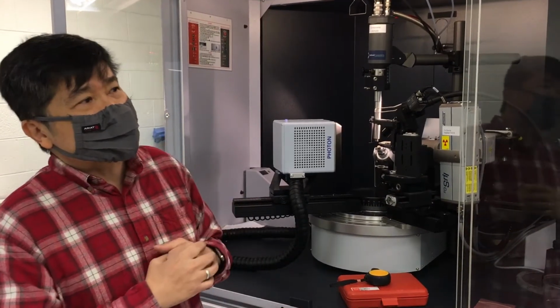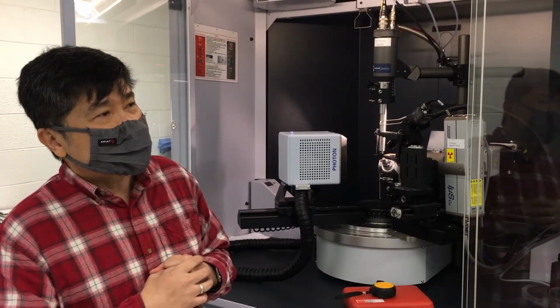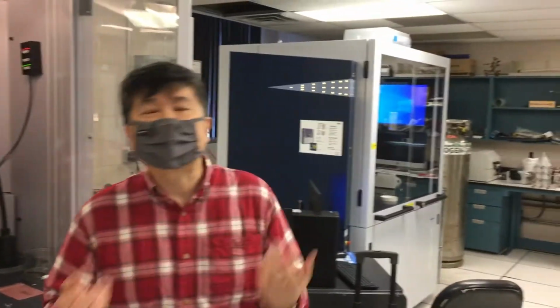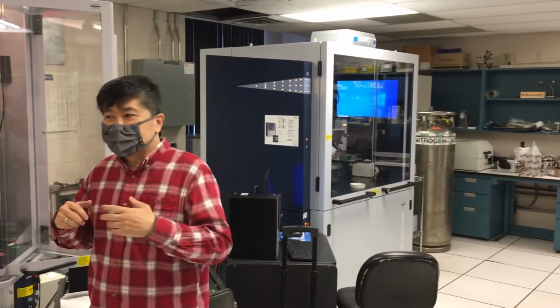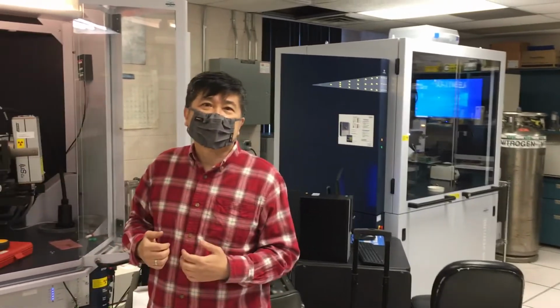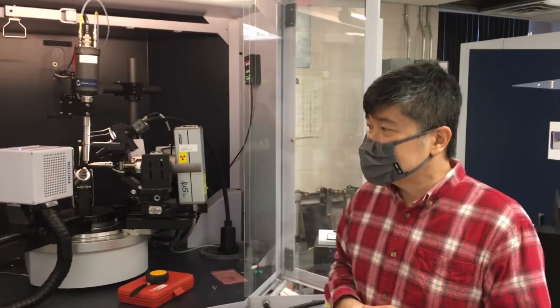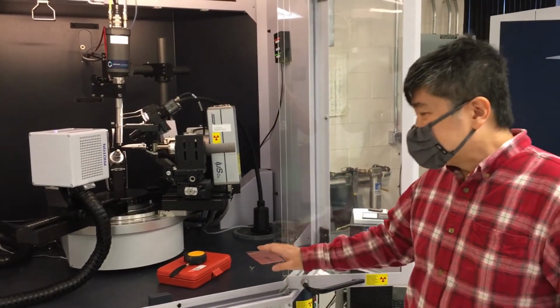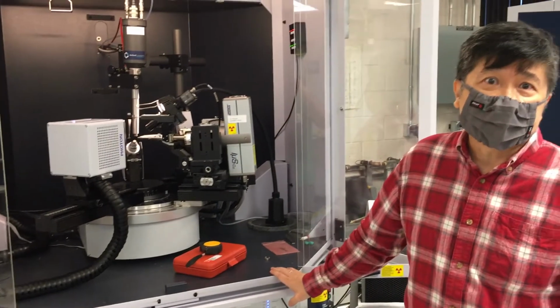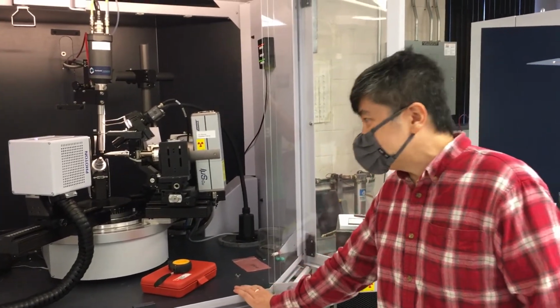So these two diffractometers are actually quite productive. And just to give an example, before this whole COVID-19 problem that has slowed things down, we sort of on average got a paper once every month. You can see that this thing is still not quite done here because the upgrade is ongoing. Hopefully within this week this will be finished.